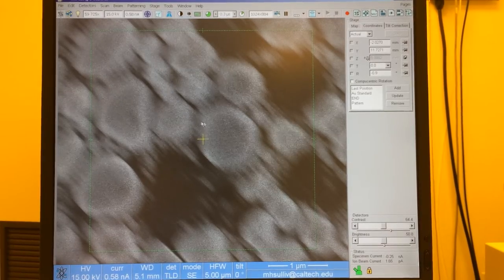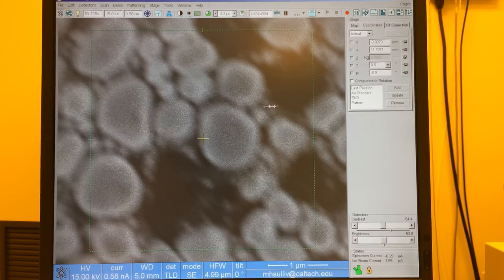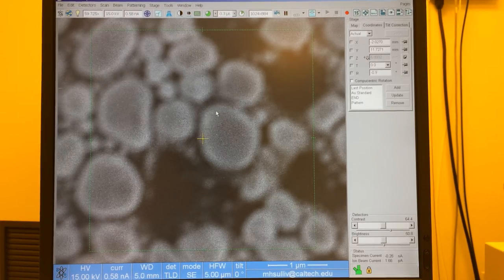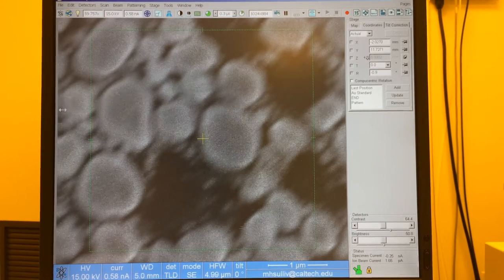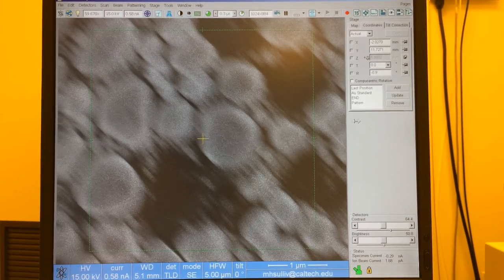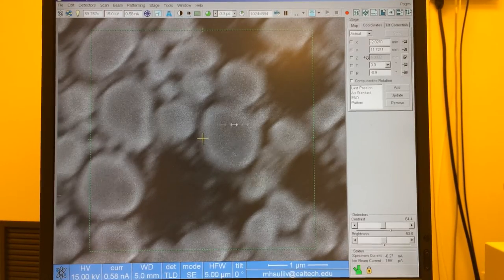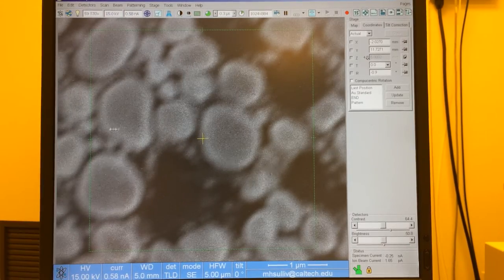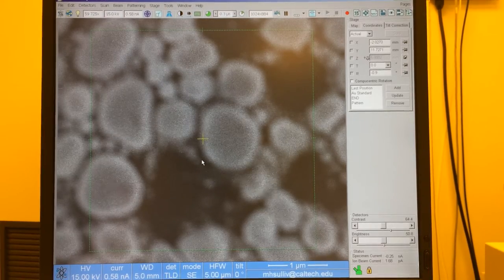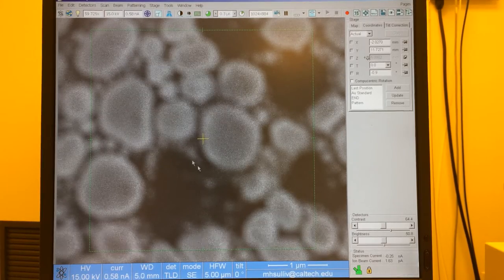And so when we see this astigmatism, as I said in the previous video, what we always want to do is try to bring focus somewhere in between where we have equal blurriness along all edges of our particle or our feature. I like to refer to it as an inflection point. So as I go to the right, I can see stretching along one axis. To the left, I can get it to flip. And so I want to be at the inflection point somewhere in between where it's just equally blurry along all edges. Once you're at focus there, we would use astigmatism, shift right click to go left and right, up and down until we got a sharper image.